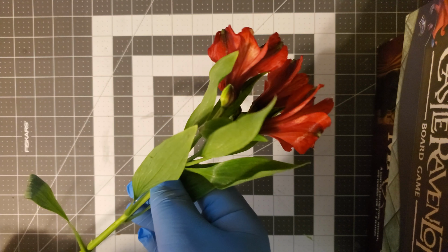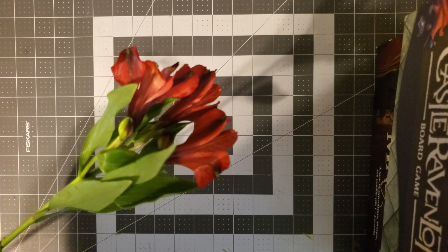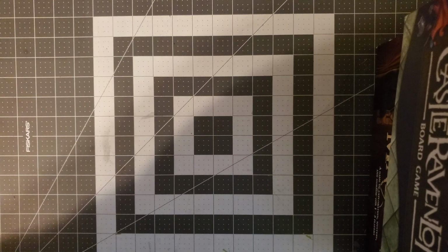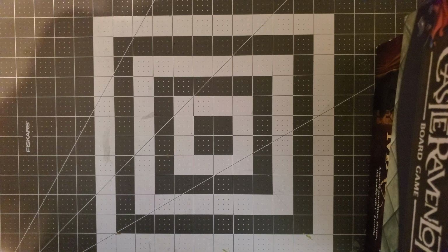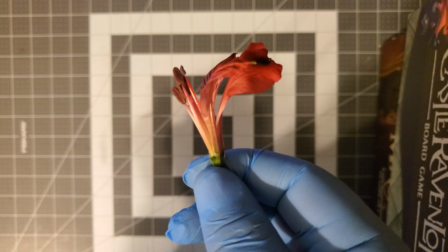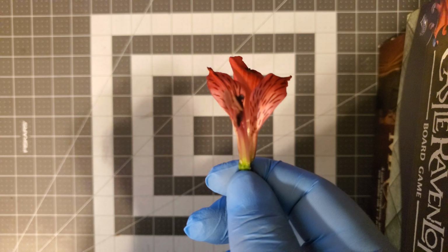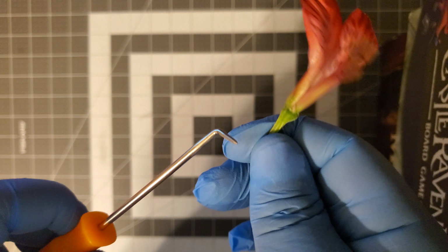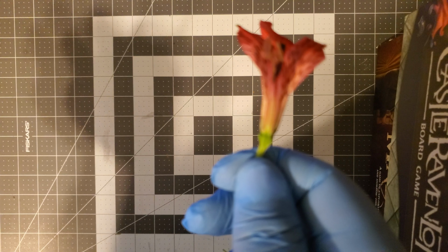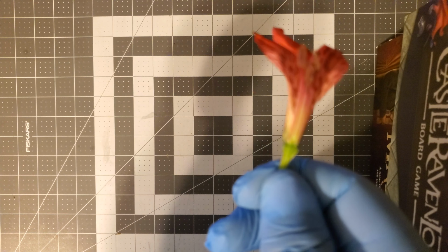But all these leaves and groups of flowers are kind of in the way, so let's get a little bit more close and personal with one part of the flower. Alrighty, here we go. So now we're nice and close to the flower, and you can see the thicker part where my hand is right here, which is basically the receptacle. This is where all the flower organs would grow.